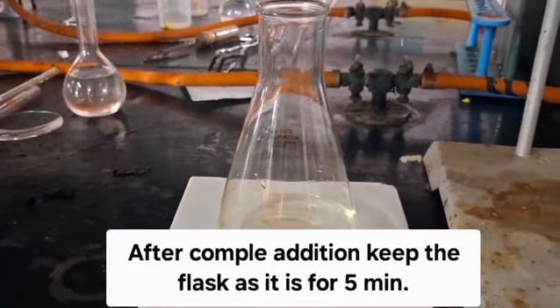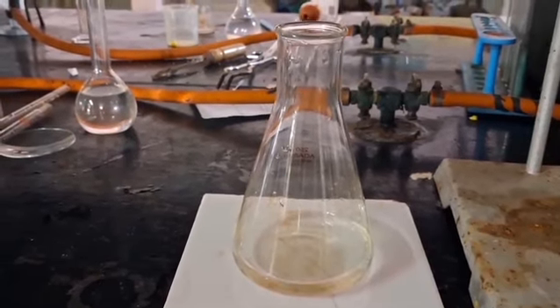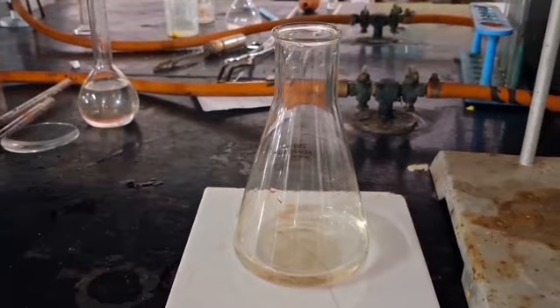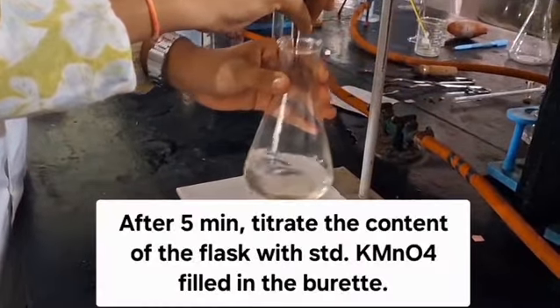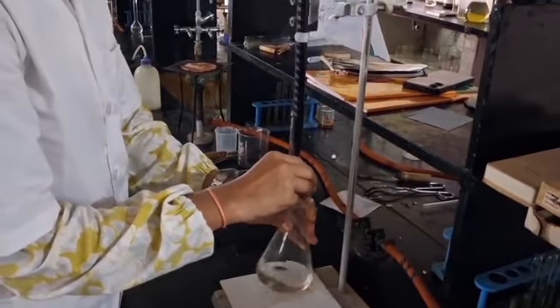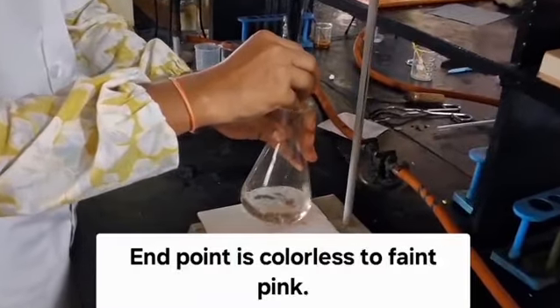After complete addition of 25 ml of 0.1 normal ferrous alum solution, keep the flask for 5 minutes undisturbed to allow the reaction between persulphate ion and ferrous alum solution. After 5 minutes, titrate the content of the flask with 0.1 normal standardized KMnO4 solution till the endpoint becomes colorless to faint pink.